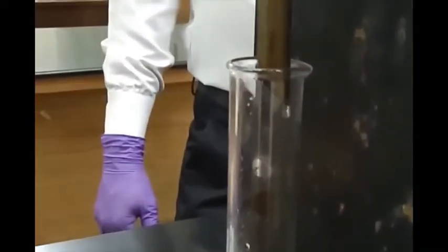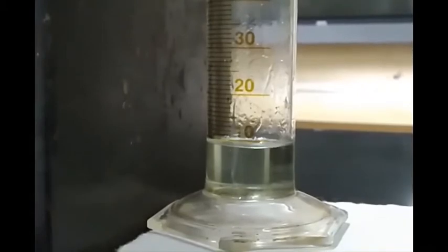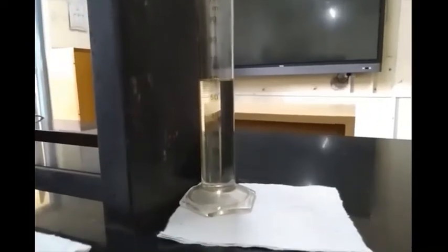Once boiling starts, the distillate is collected in the receiver. We note down the temperature for every 10 ml rise in the level of liquid. You can observe the liquid rising to the 10 ml mark — just when it reaches 10 ml, we note the temperature. The boiling continues and we get more liquid in the receiver. We go on taking readings at 20 ml, 30 ml. Now you can observe the level is around 32 ml. More liquid gets collected — now it's 60 ml, and we note the reading at 60 ml.